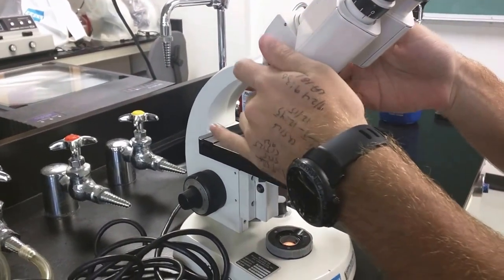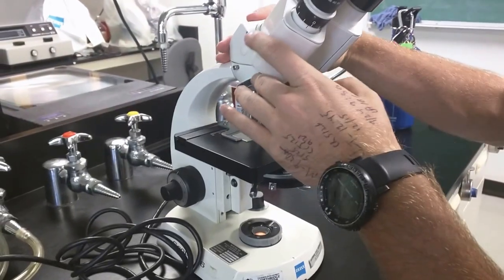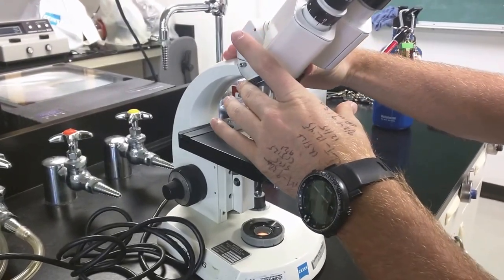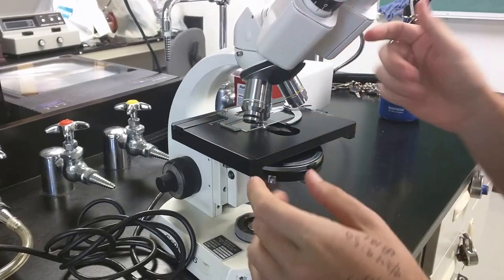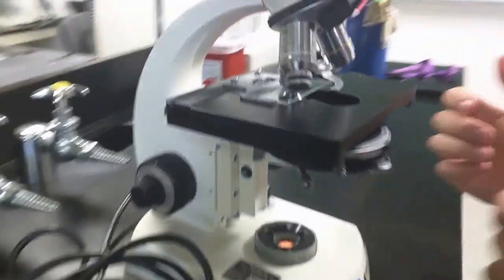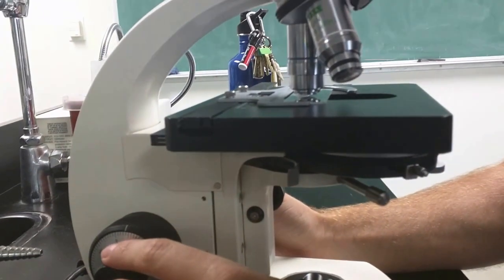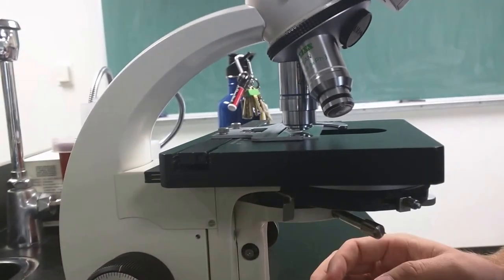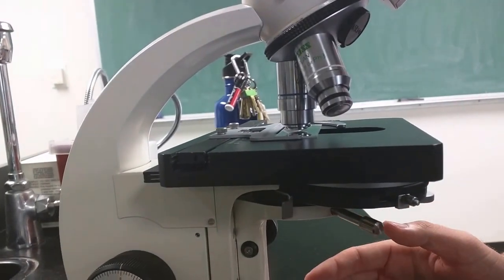As long as you are in focus at the 10x in sharp focus, since these microscopes are par focal, we can drop the 40x in place and not be worried about the lens touching the slide or scraping the slide. I'm just going to refine focus, refocus, and then do the same process over again.